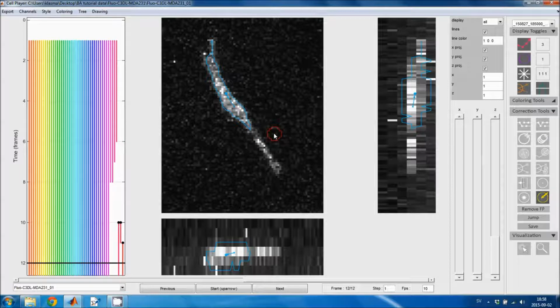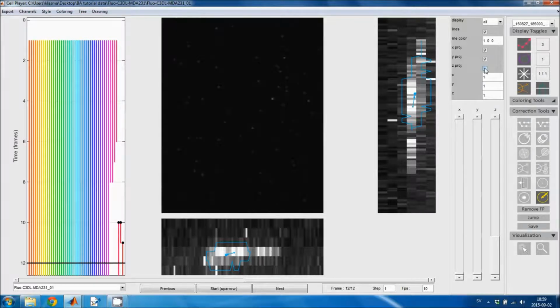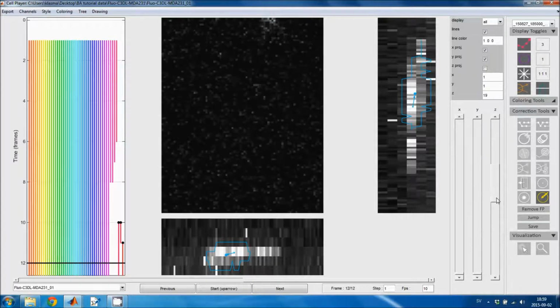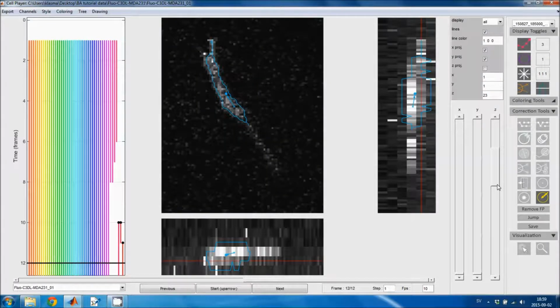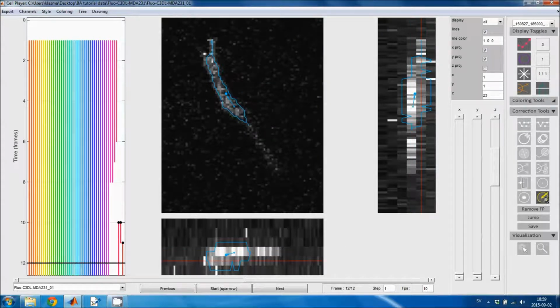I'm not allowed to perform segmentation editing directly in the maximum intensity projection, because then the program wouldn't know which Z-slice to place the edits in. So I get this error message. I need to deselect the maximum intensity projection, and then I can go to the desired slice either by moving on the slider here or by using the zoom tool and holding shift down when I click on the Z-slice that I want. I could actually start here, and then I'll just draw just as in the 2D segmentation editing.